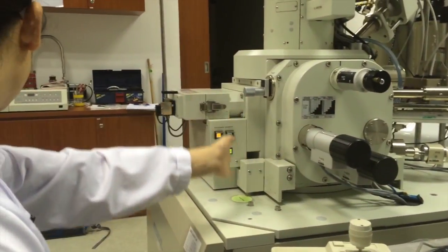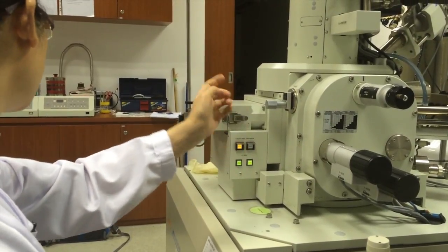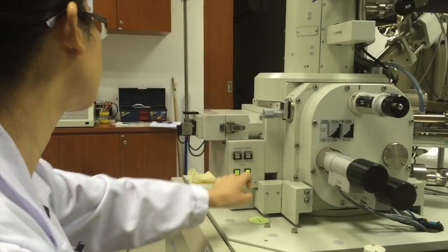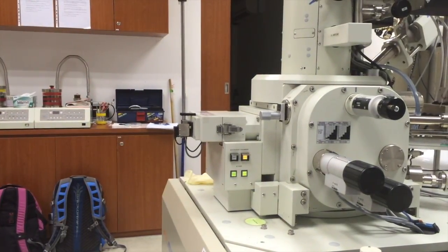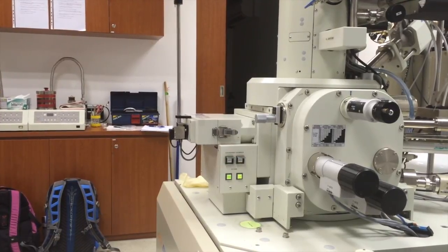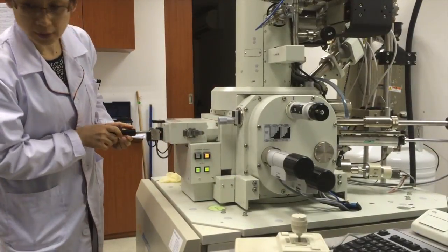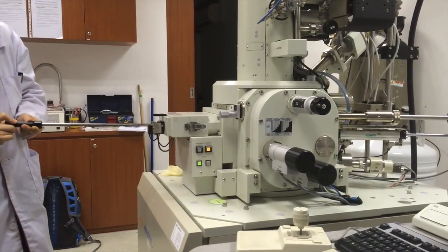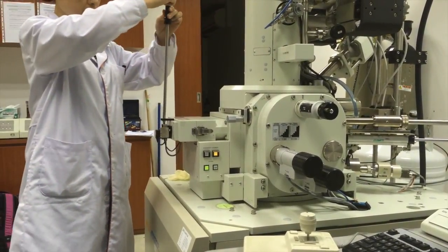When unloading the sample, switch to LEI and hit the HT off button, and the button will change color to blue. Recall the stage exchange position to x equals 35, y equals 25, r equals 0, z equals 8, and the tilt equals 0. On clicking exchange or home, the SEM will automatically reset the coordinates.